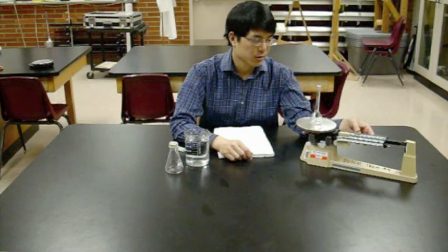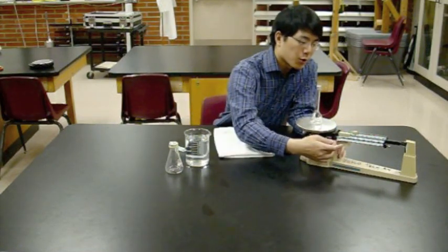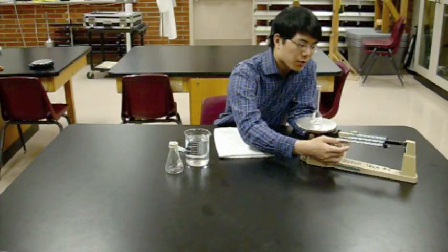I'm going the wrong way. I'm not adding enough mass. There we go. Tip the scales right there. So back off one from where I tipped the scales, and then move down to the next slider.